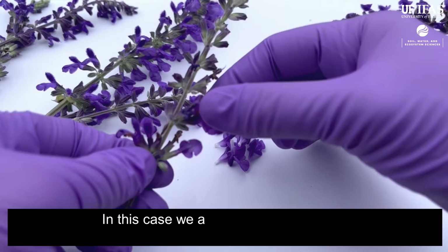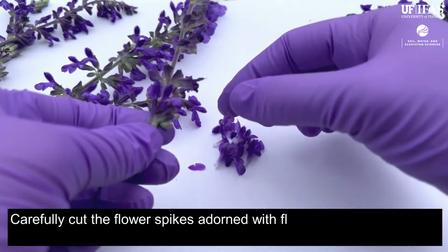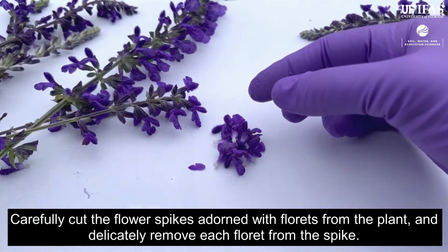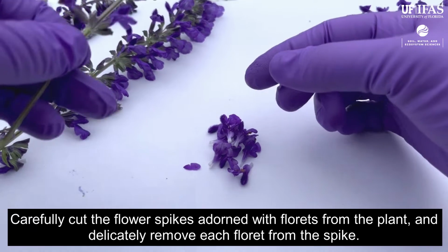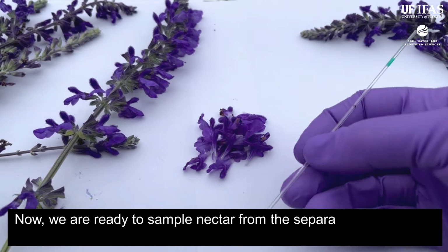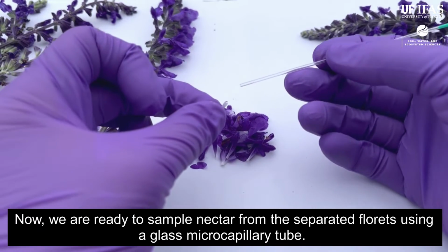In this case, we are working with salvia. Carefully cut the flower spikes adorned with florets from the plant and delicately remove each floret from the spike. Now we are ready to sample nectar from the separated florets using a glass microcapillary tube.